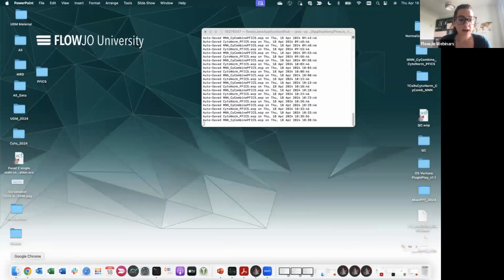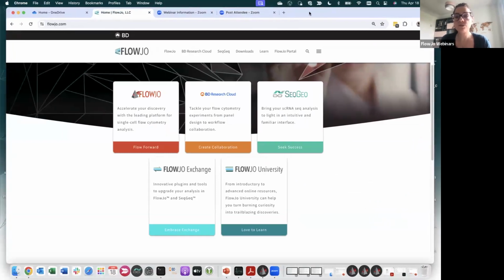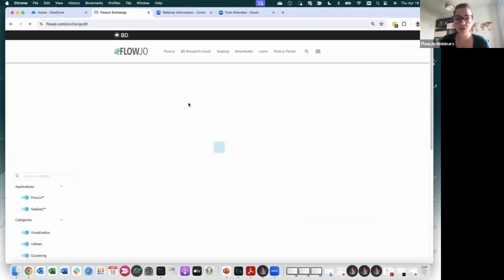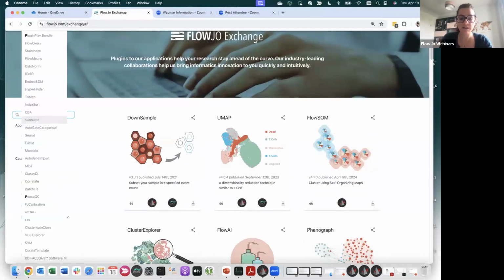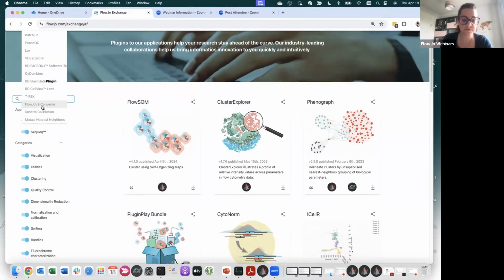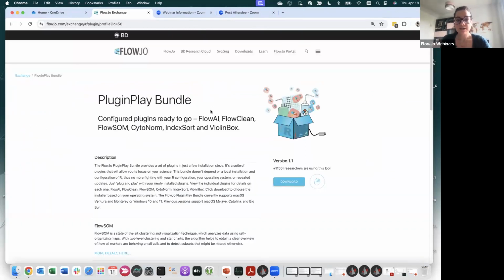So I can show you how to use this within FlowJo. First of all, if you want to download any of the algorithms, you may want to go to the FlowJo Exchange. You can access it from FlowJo, or you can go on our webpage and click on the FlowJo Exchange right here. And then you can just type in the search area, plug and play. Let's see if it comes up. Yeah, plug and play bundle right here.